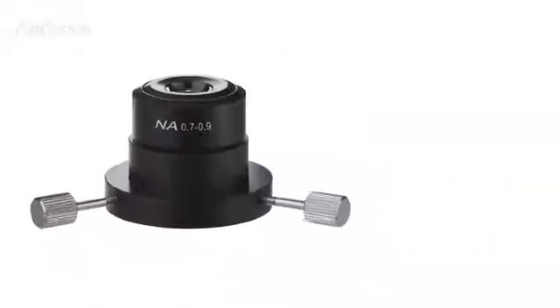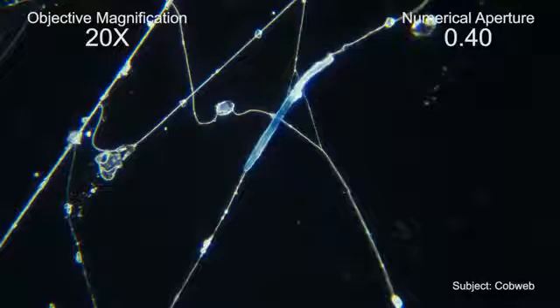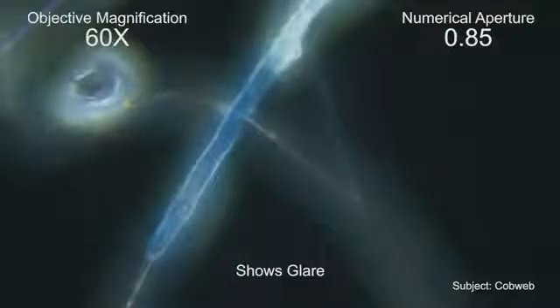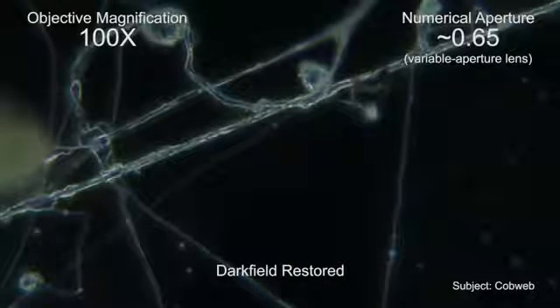When choosing a Darkfield condenser, be sure the condenser's numerical aperture is larger than the numerical aperture of the objective lens you plan to use. If the objective lens's aperture is larger than the condenser's, direct light will be transmitted and a dark field will not be achieved. At the dry condenser's upper limit, this image shows noticeable glare. Well above the condenser's limit, the dark field is completely lost. By reducing the aperture of the lens, the dark field may be restored.